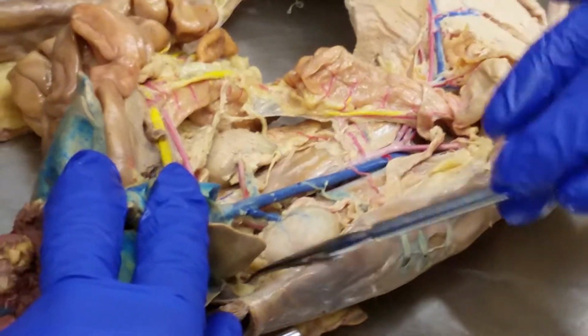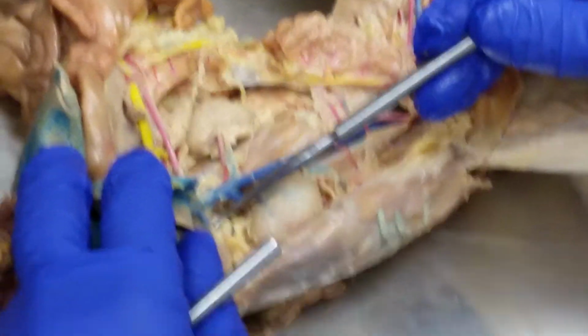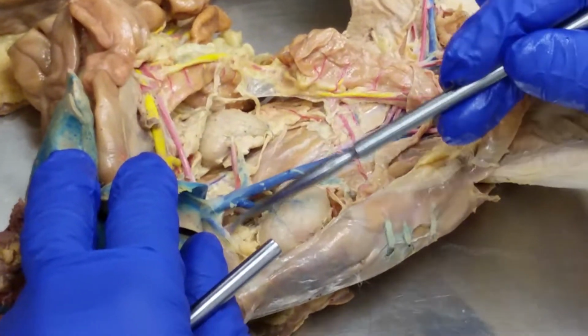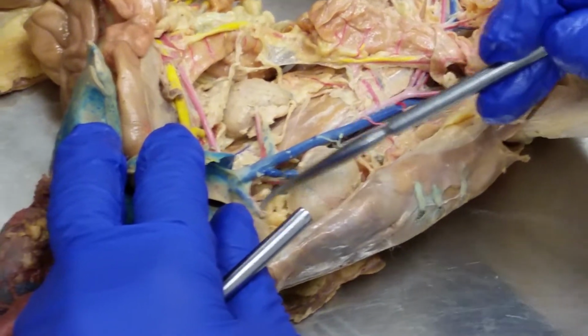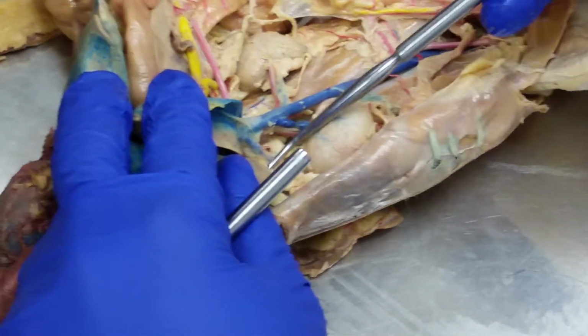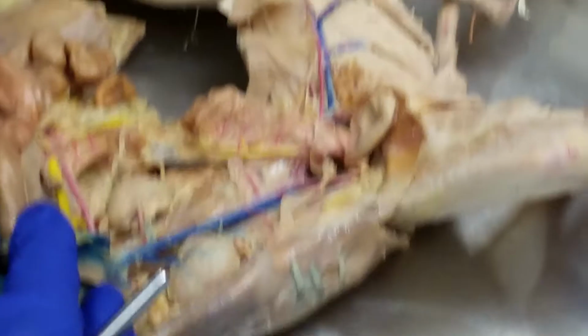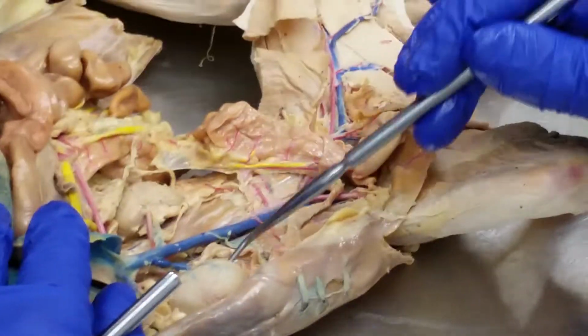So here, on top of the kidney, what gland do we have? The adrenal gland. So it's going to be the adrenal vein. Normally you see them both. Yeah, the artery is there. It's kind of hidden in this fat, but you see, there's a little one right there. But you can see the adrenal vein here, supplying and draining the adrenal glands. Okay.